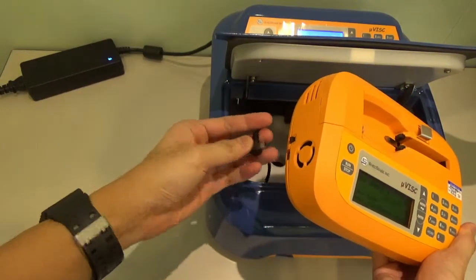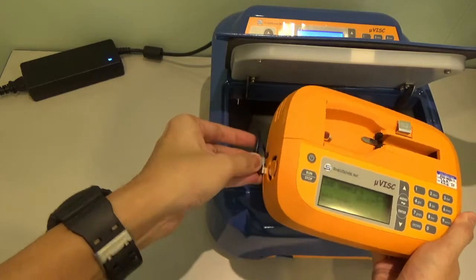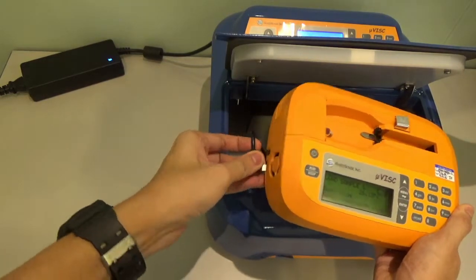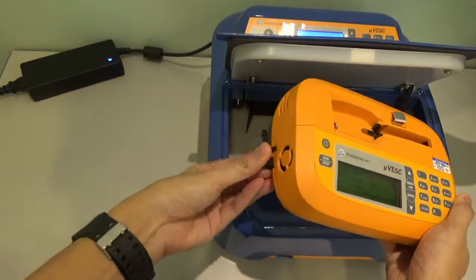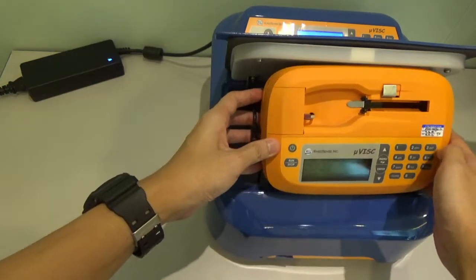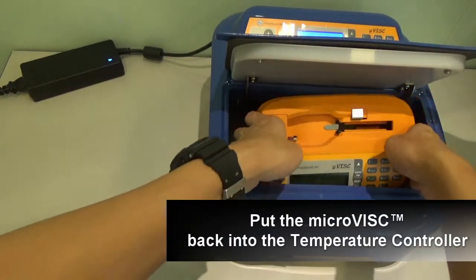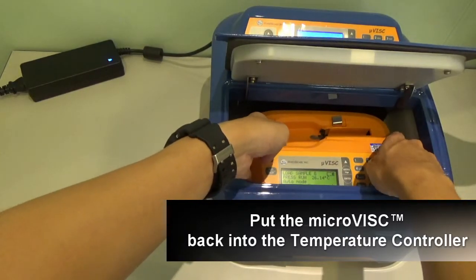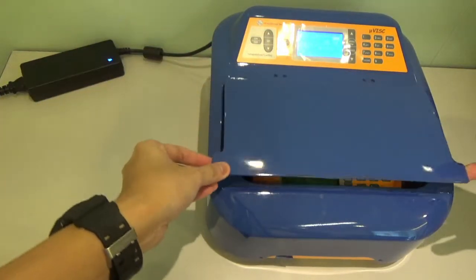And there's another cable on the left. Then you just insert this whole machine into the temperature controller and close it.